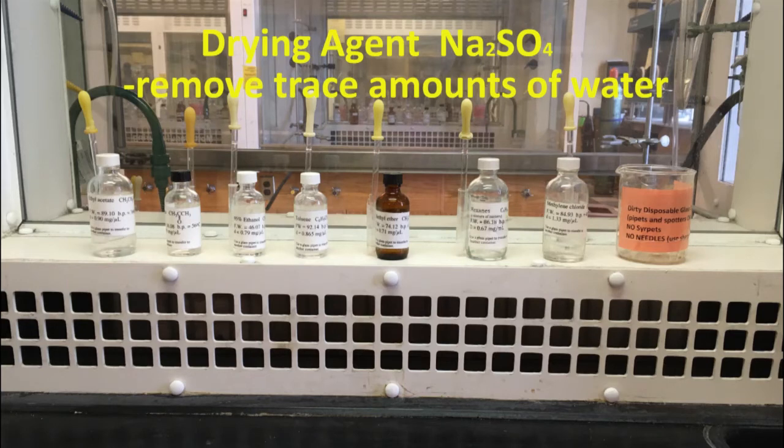Now that you have washed the pooled diethyl ether extracts, there's still a chance that residual amounts of water remain in the organic layer. To remove trace amounts of water, we will use a drying agent, anhydrous sodium sulfate, Na2SO4, which will adsorb any water molecules present. This is referred to as drying the organic layer.